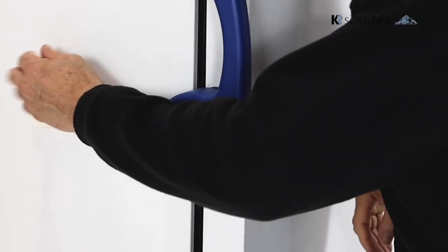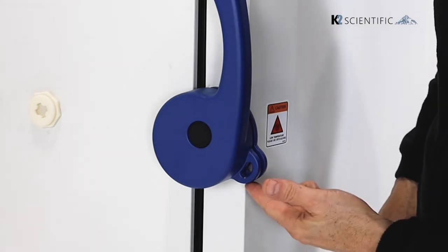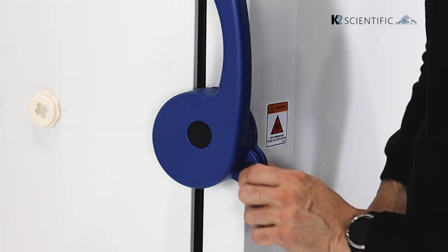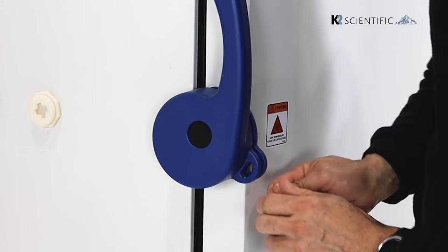There is not a key lock on the K221ULT. Instead, you have a lock opening where you can put a padlock or a key lock.